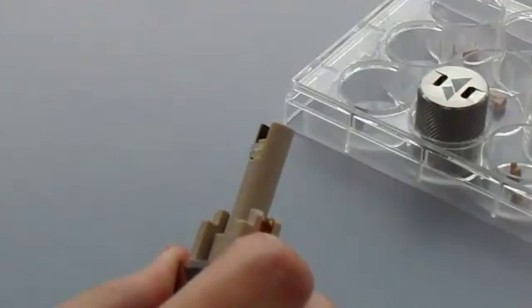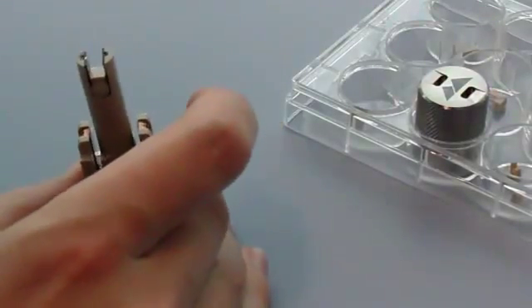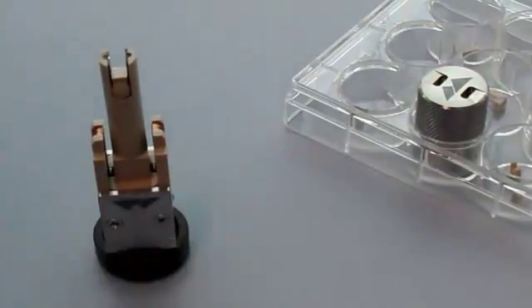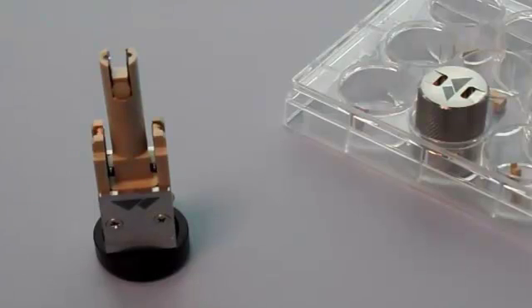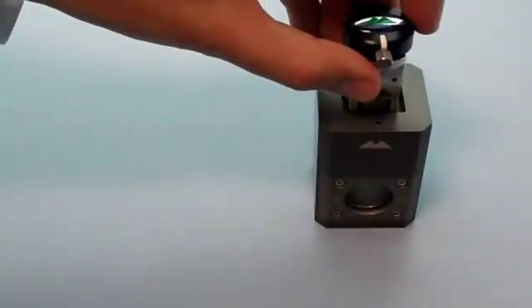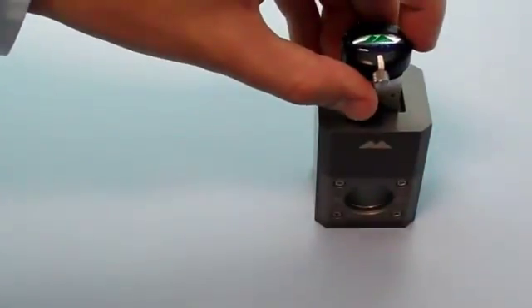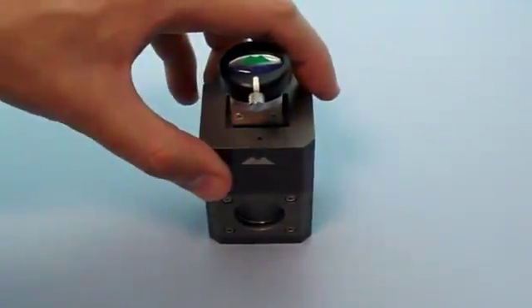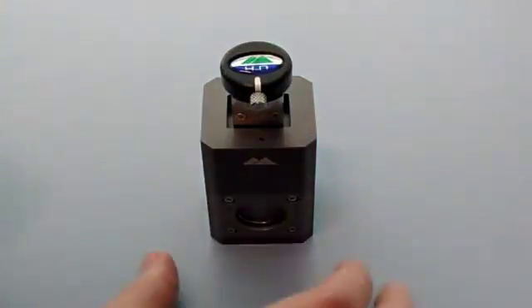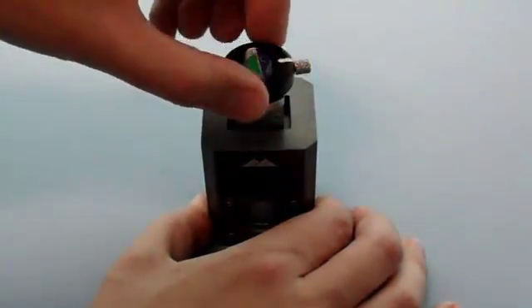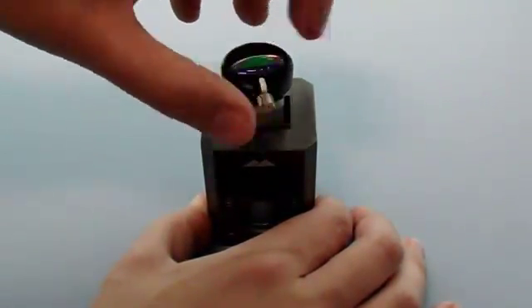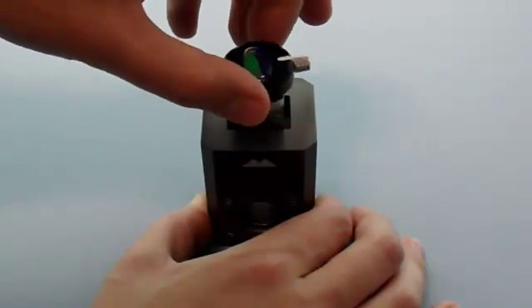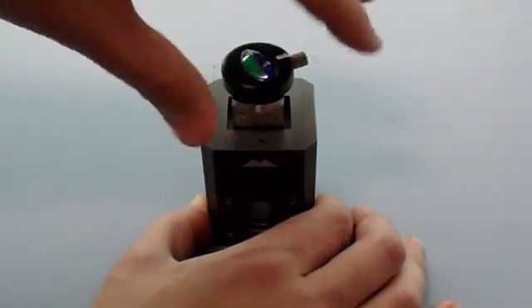When the sample is measured, its position relative to the laser beam within the zetasizer must be known. The height of the sample in the cell must therefore be zeroed against the laser. The first stage of this is a coarse cell alignment, which is done using the cell height alignment tool. Place the cell into the tool so that the curved front of the cell is facing the front of the tool, marked with a spot on the top of the tool.